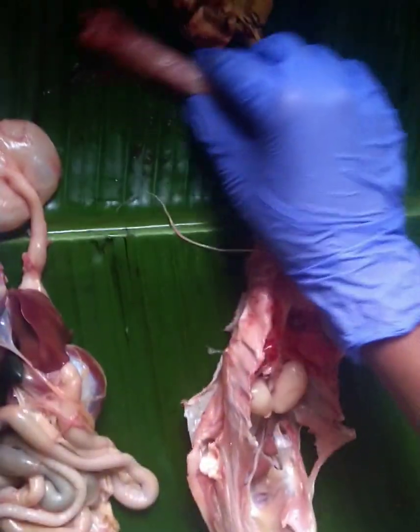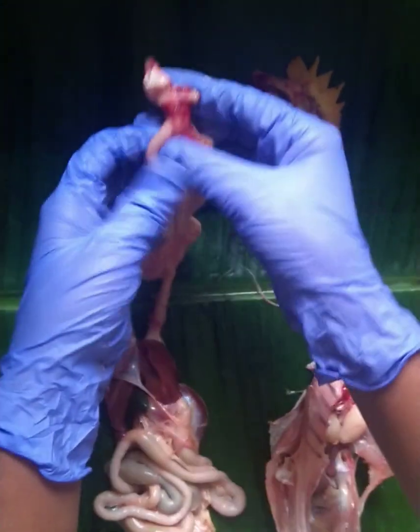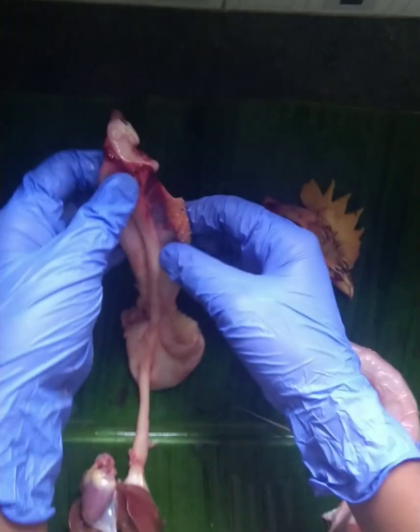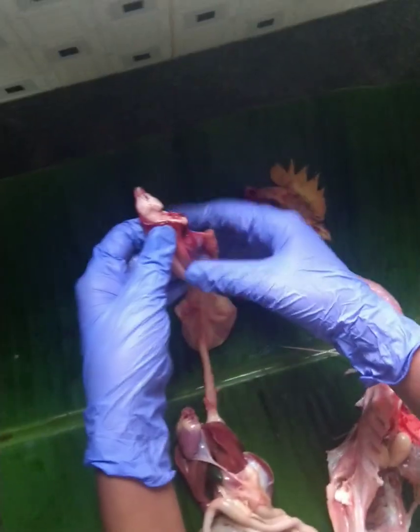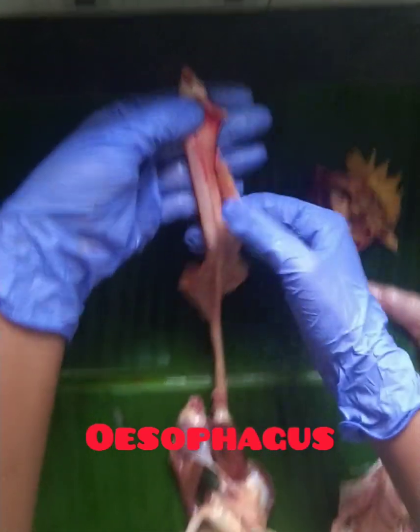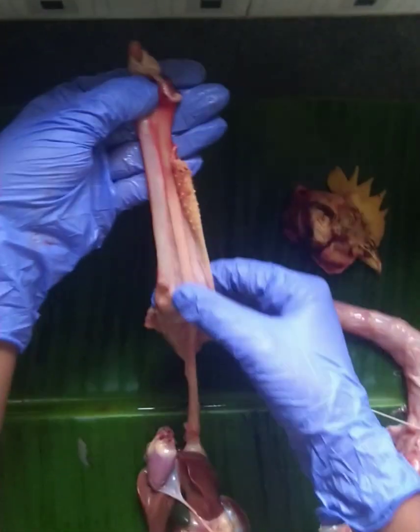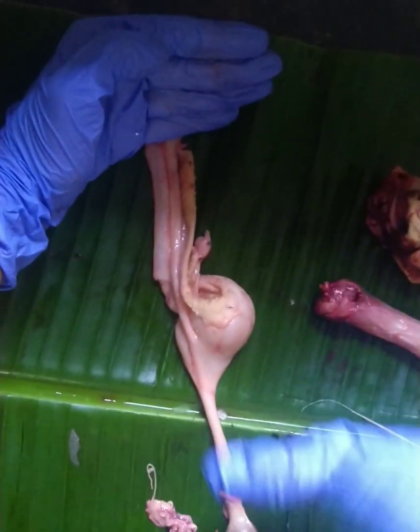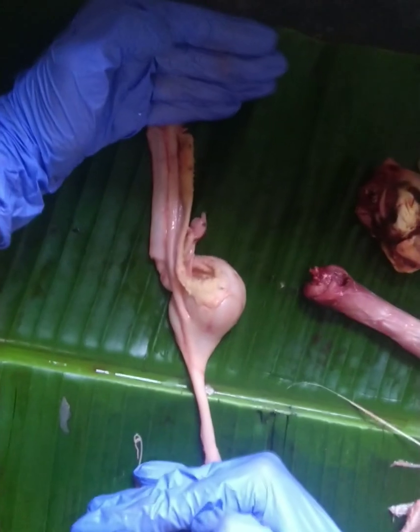Next, we will look into the digestive system. The food the chicken eats enters through the mouth cavity and later passes through the esophagus. This tube that we can see here is the esophagus — it starts from here and ends just before it enters the stomach.